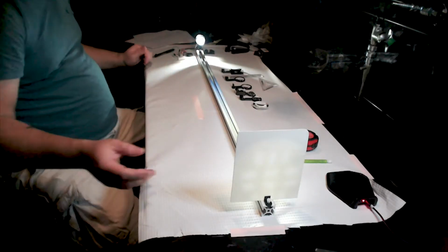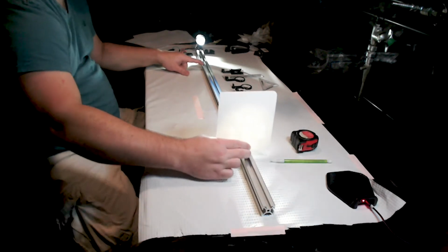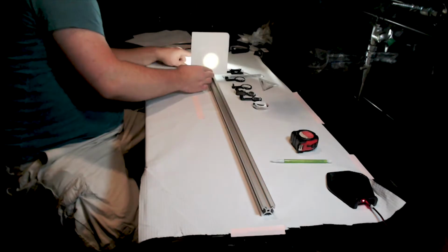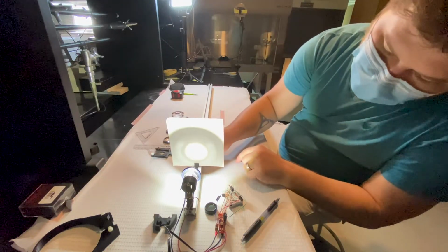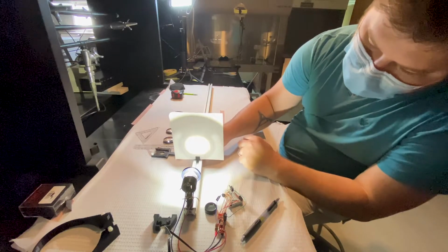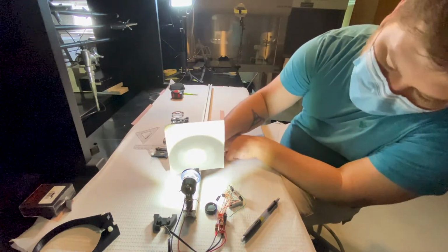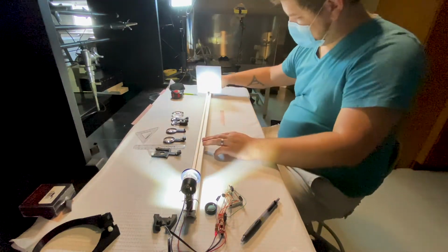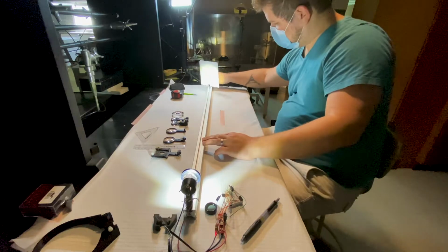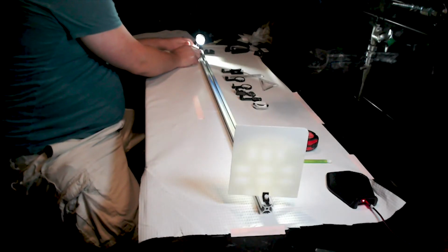We'll call that even, and I'll go ahead and sweep this so that you can see, right about here we're getting pretty nice and even illumination. So that's going to tell us what's the working distance that we have to work with, so that we're not forming this image of the LED on our sample.